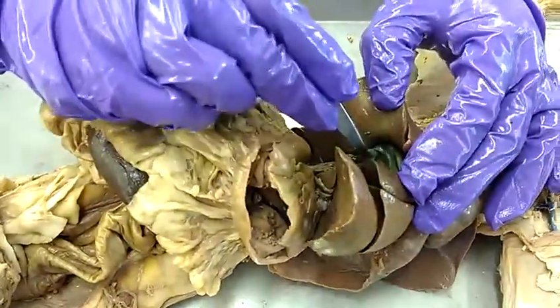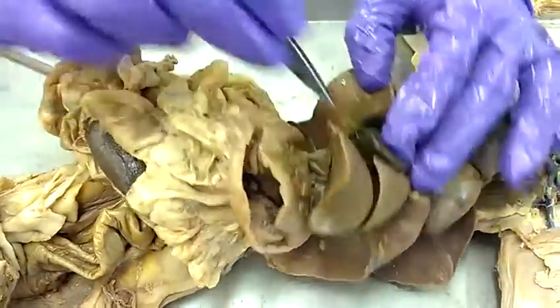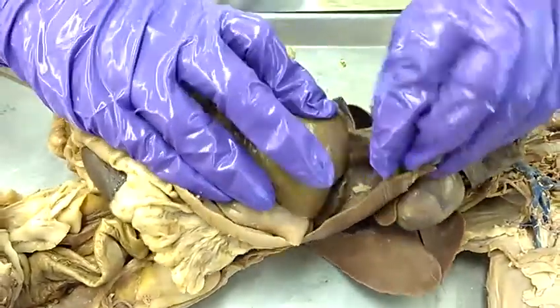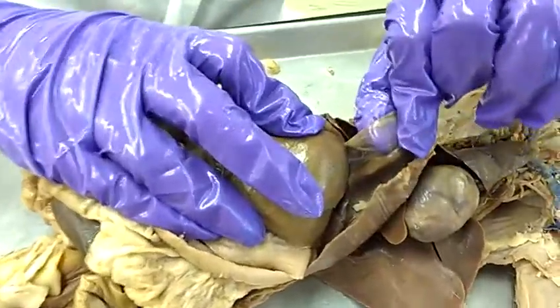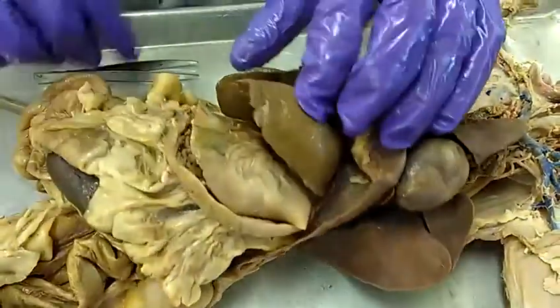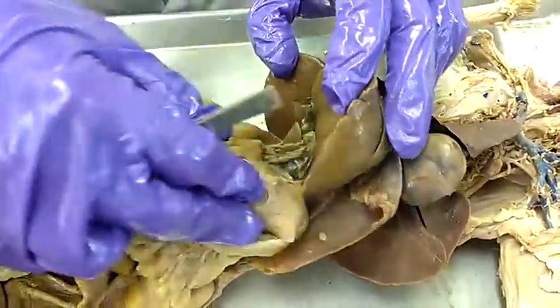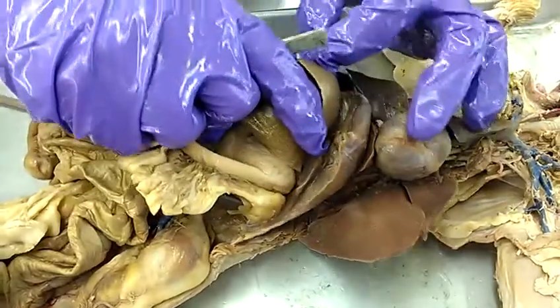What is this one? The gallbladder. Yep. What is this ligament? The falciform ligament. And we can't see the round ligament on this one — cannot see the round ligament on this cat.